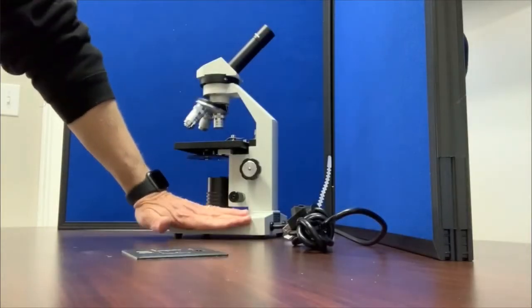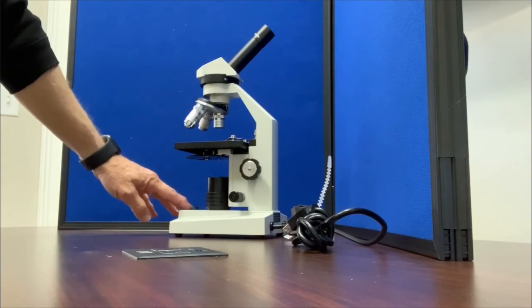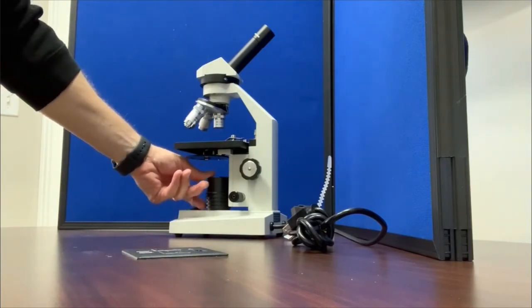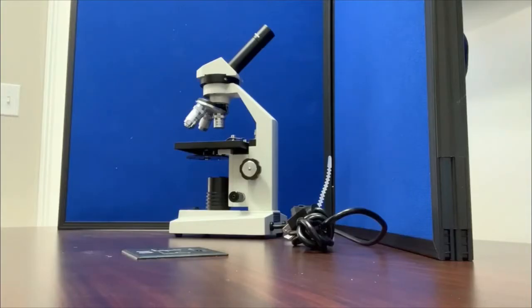This is the base of your microscope. There's an on-off light switch. There's also the illuminator field lens housing, this portion. So those are the basic components of a monocular microscope.